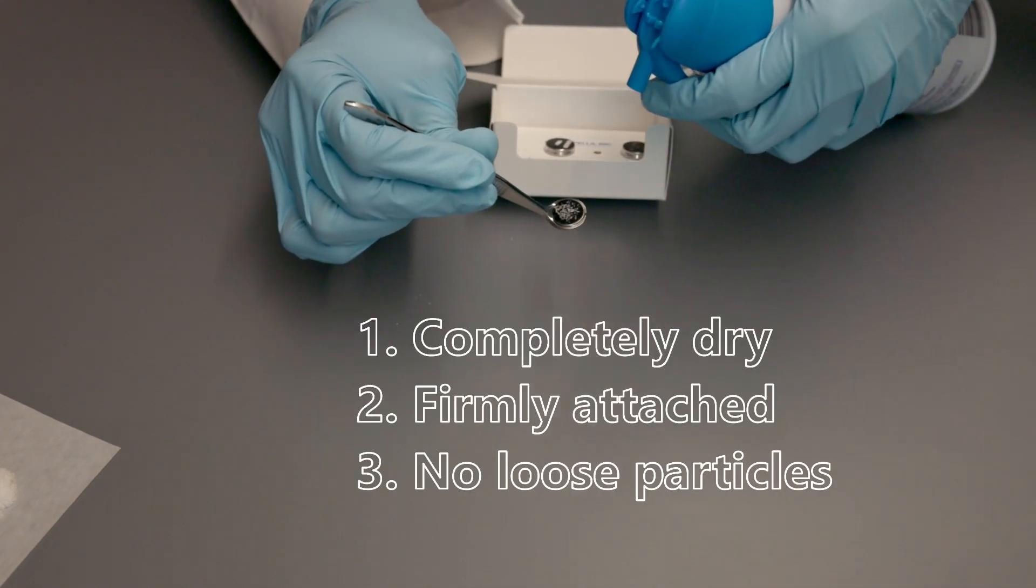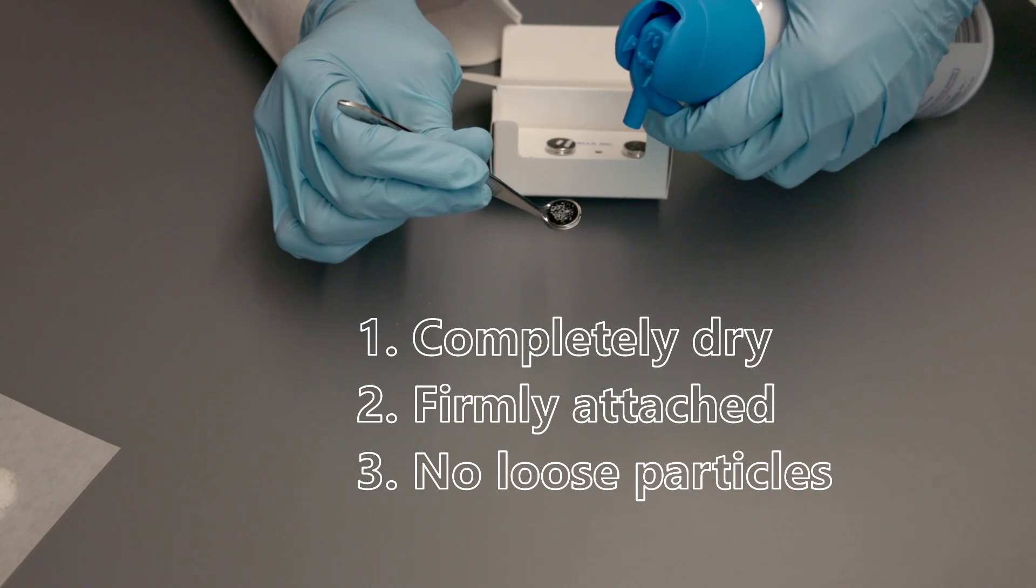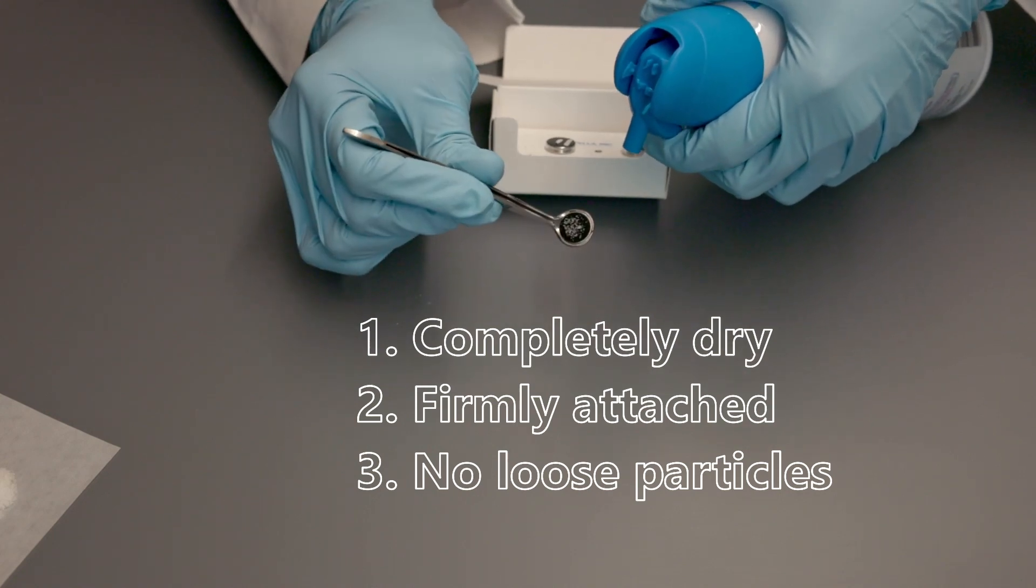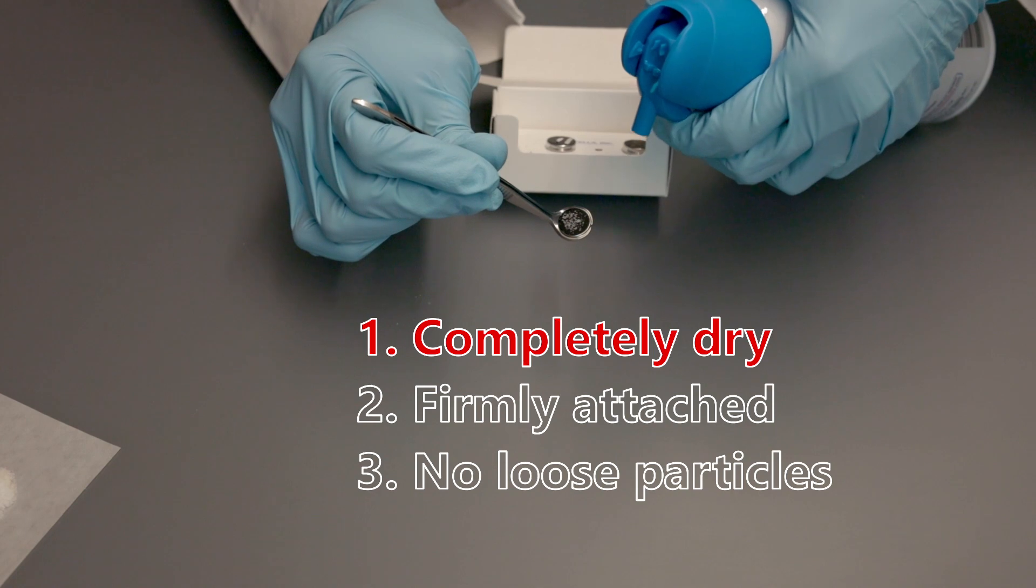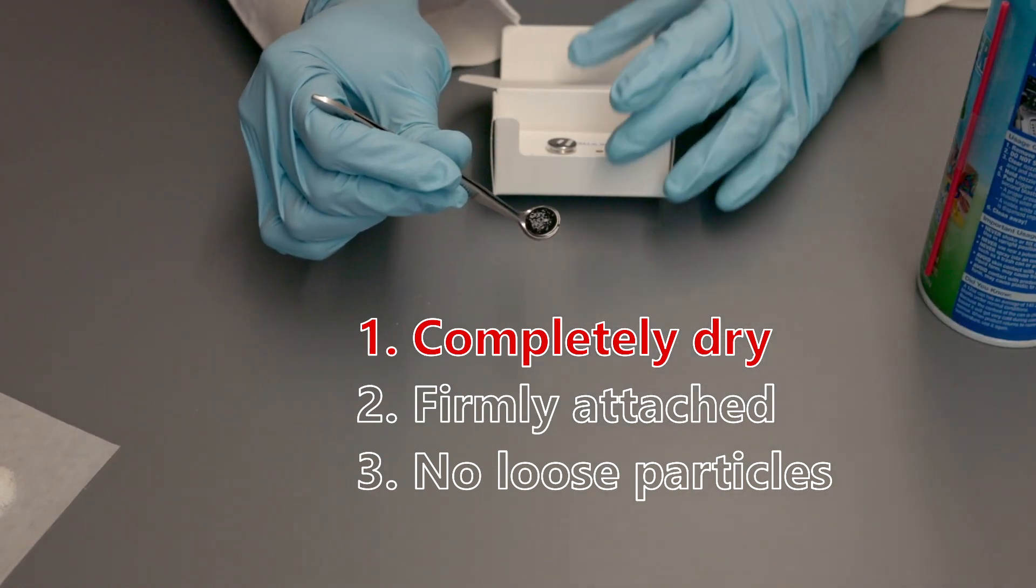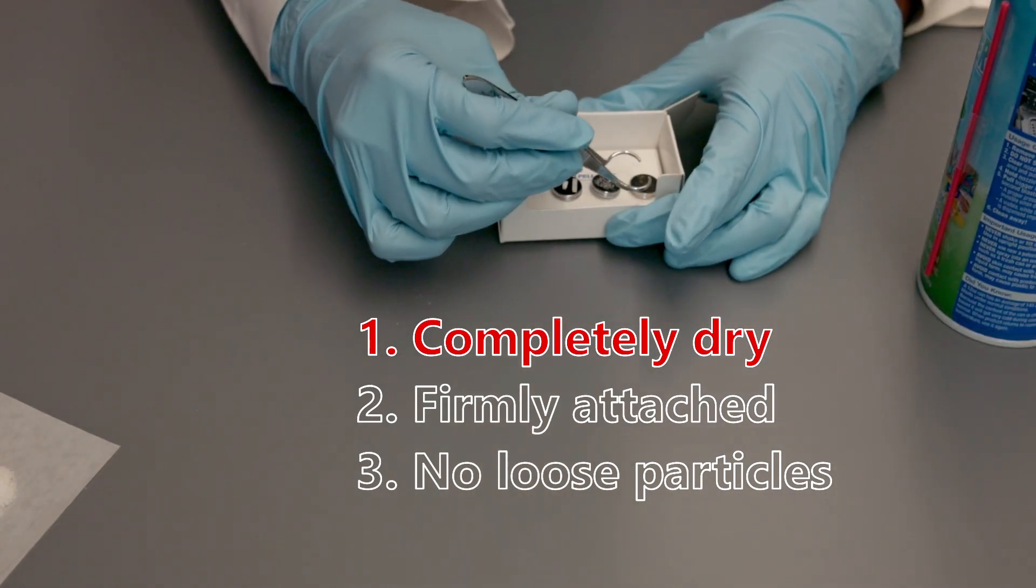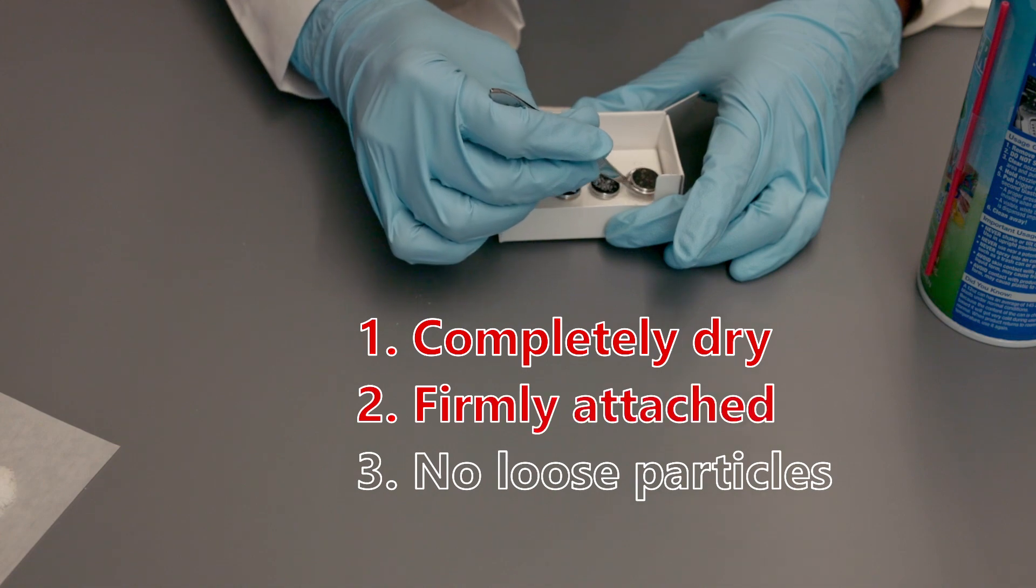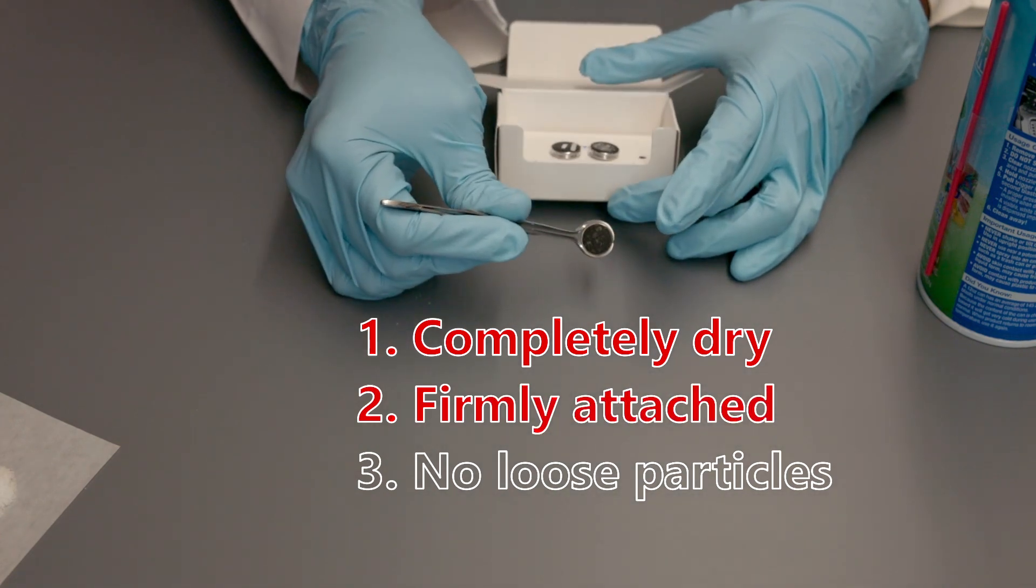Important points to remember while preparing samples for scanning electron microscopy: wet samples outgas under vacuum and can cause damage to the equipment.